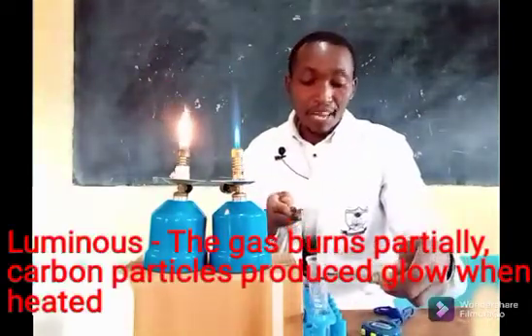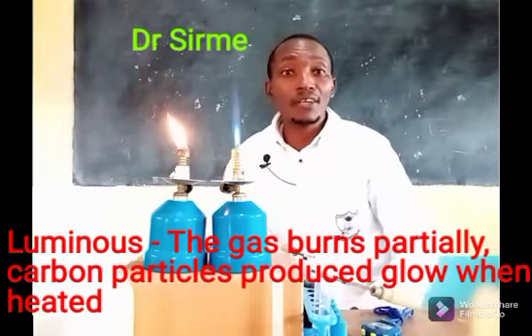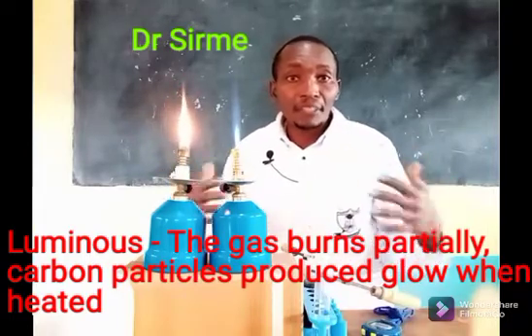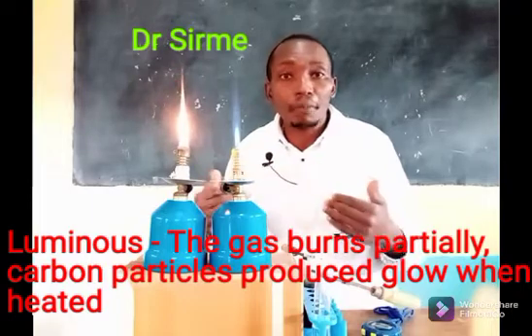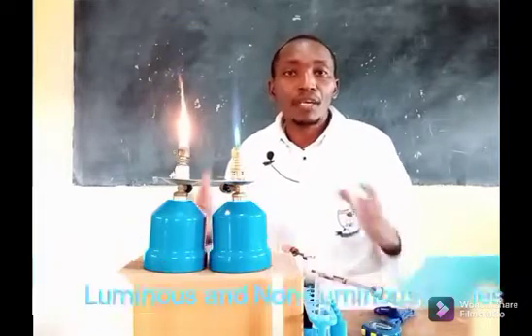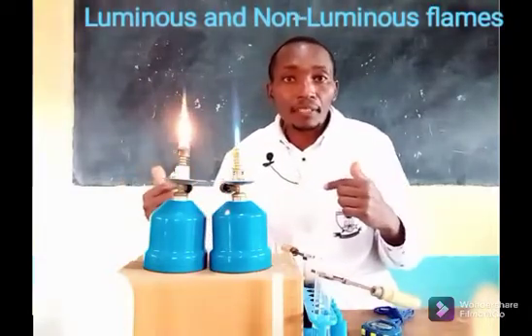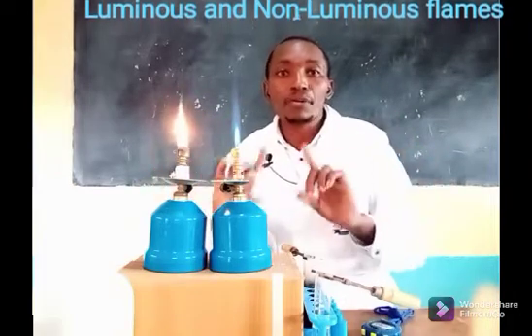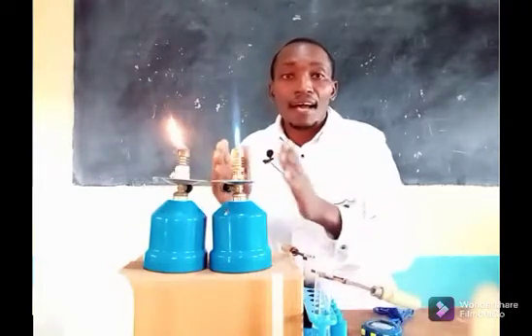You may ask yourself why there is soot. The luminous flame is produced with the air hole closed, so there is not enough oxygen getting into the chimney and the gas undergoes incomplete combustion. The carbon particles that did not burn are deposited as soot on the boiling tube. As for why the luminous flame is yellow: those same carbon particles, when heated, glow and produce the yellow colour.